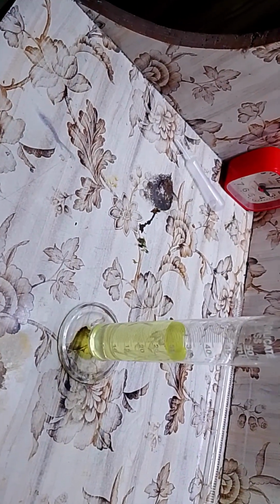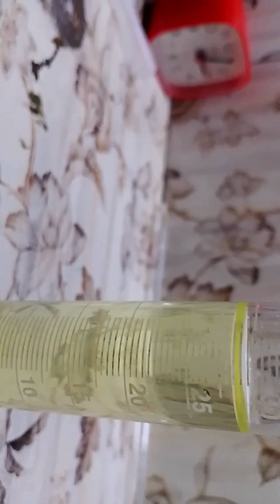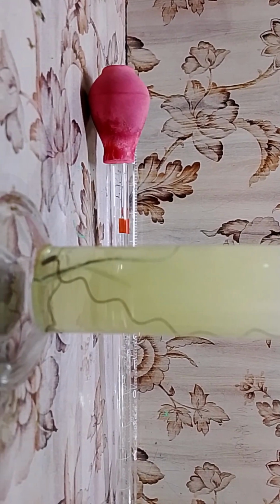Now the second confirmation test is a thin wire of iron. You will be able to see it, I presume. Yeah, you can see it now. Now this is a part of a spring and it should react with the sulfuric acid after a while because the oxide layer needs to go away. So we'll just wait for a few seconds. Okay, I hope you will be able to see the effervescence being done by the action of sulfuric acid on iron. And see the effervescence.